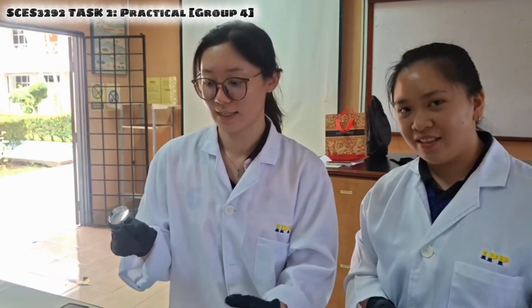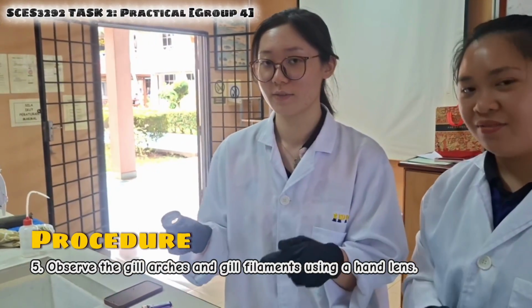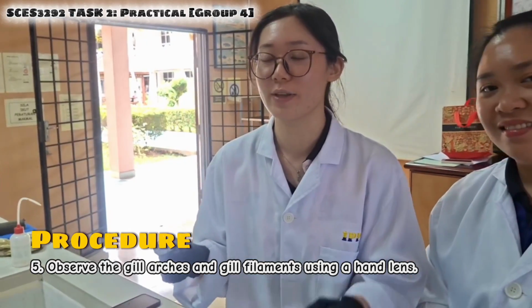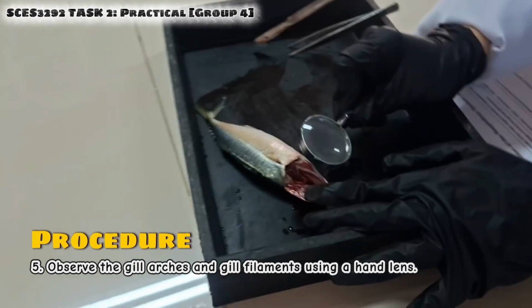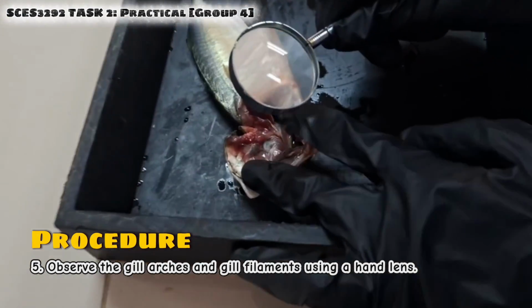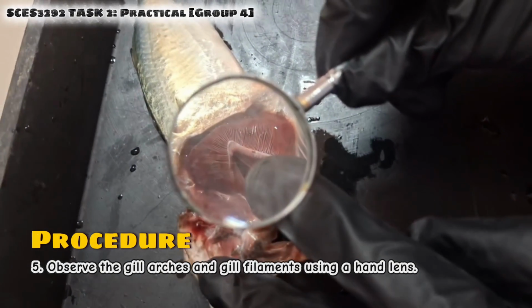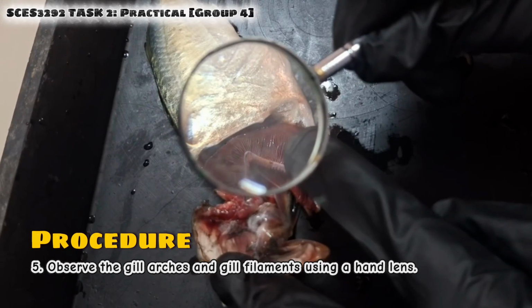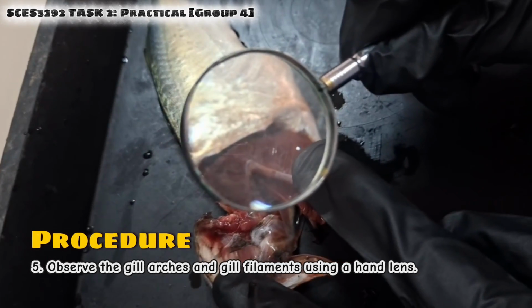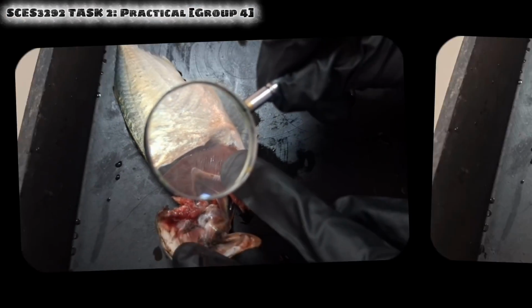We have done dissecting the operculum, so we are now going to observe the gill arches and also gill filaments using a hand lens. Okay, so let's see. The white part is the gill arches, and the striped things are the gill filaments.